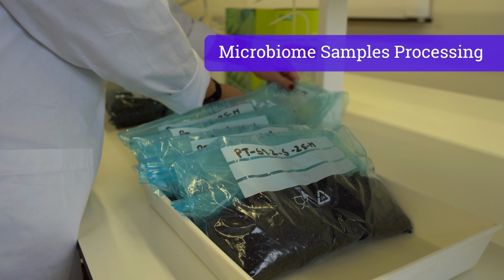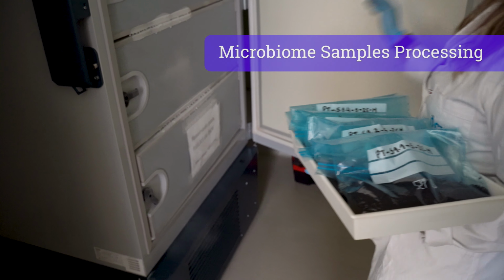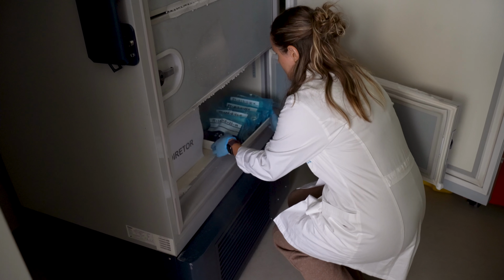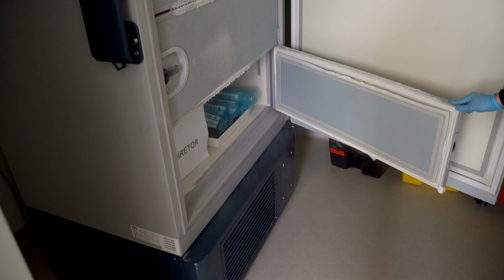Freeze soil samples for microbiome analysis at -80 degrees Celsius as soon as possible after collection. Ensure all bags are clearly labeled and tightly sealed. These will be the samples for shipment. Samples should be shipped within 2 weeks of collection.